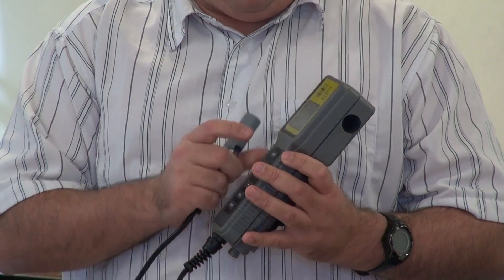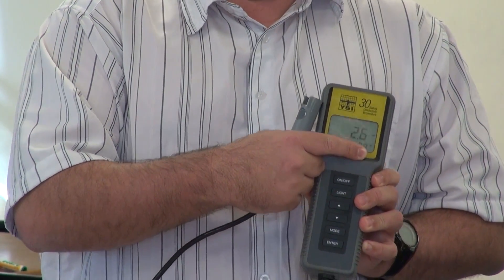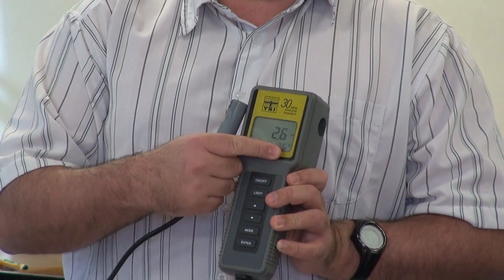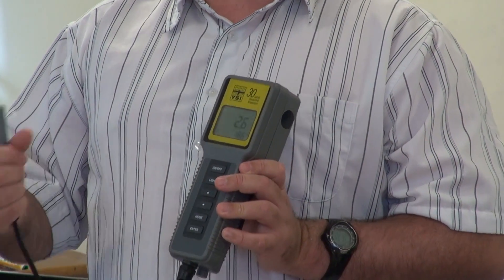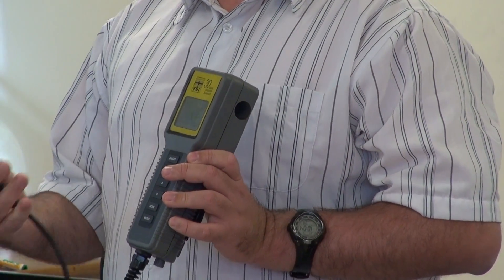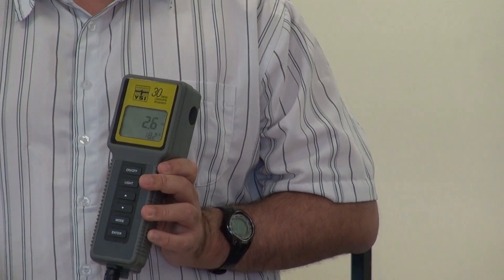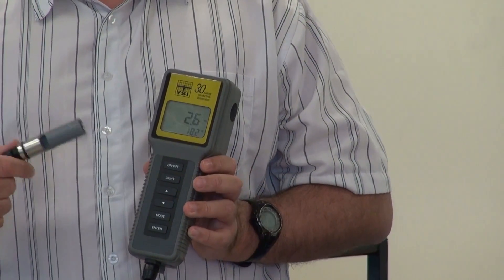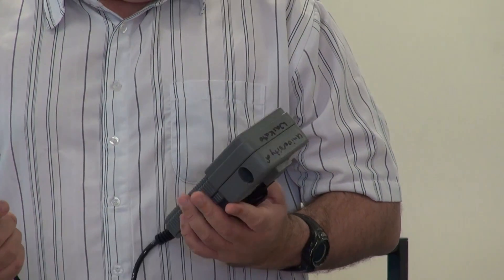And if you just change it to mode, C stops flashing and you have ambient conductivity. So it's the conductivity at the particular temperature. You probably want to write both those figures down when you're taking measurements. You should be able to convert between one and the other.